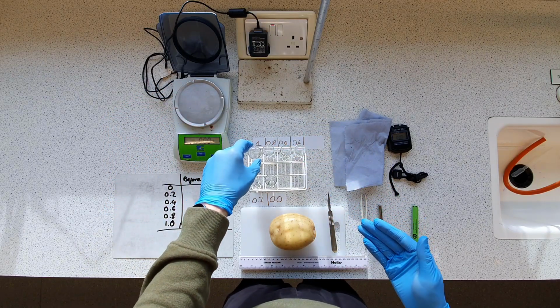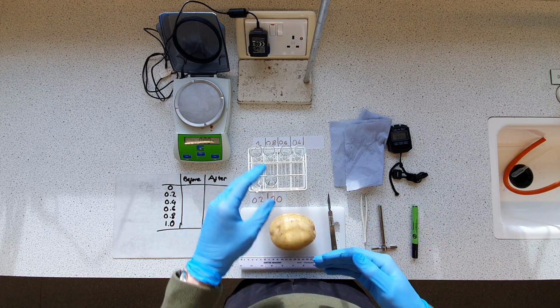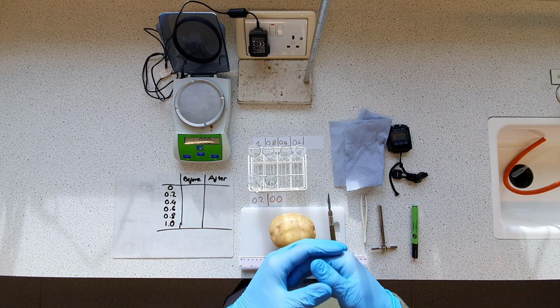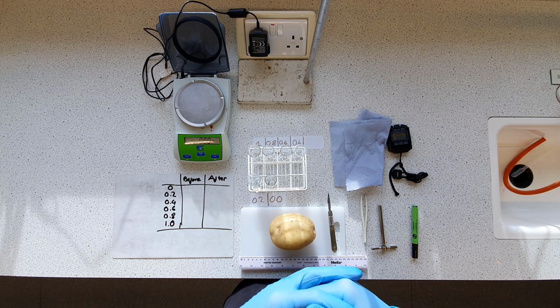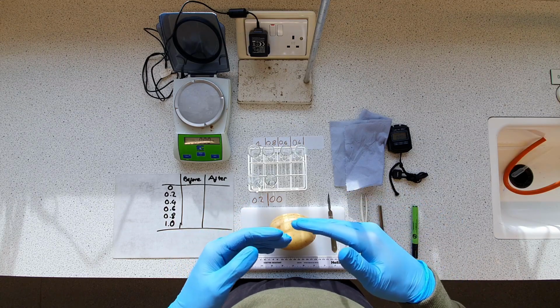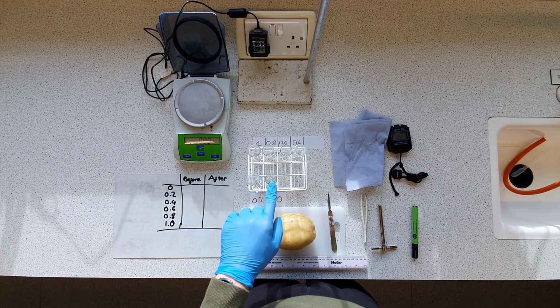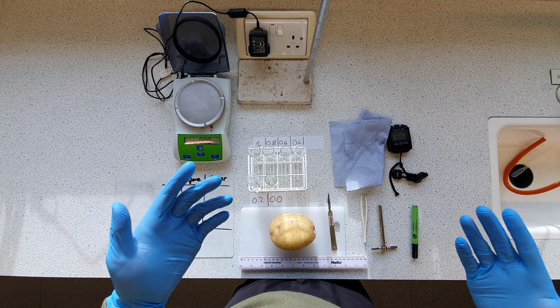liquid in them, a solution of varying molarity of sucrose, so table sugar. So we've got 1 molar, 0.8, 0.6, 0.4, 0.2 and 0.0. And this will give a nice range of water concentration inverse to the sugar concentration. If you put more sugar in something, there's less water in it, basically put. So we've got 0.0 concentration here, which is just pure distilled water, effectively 100% water, very high water concentration or water potential.